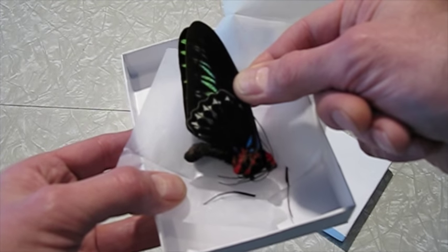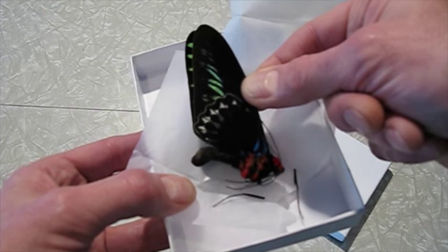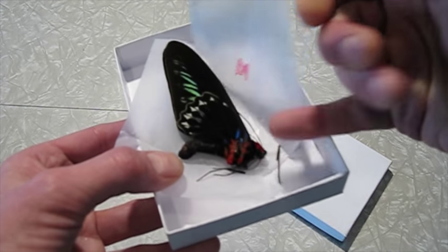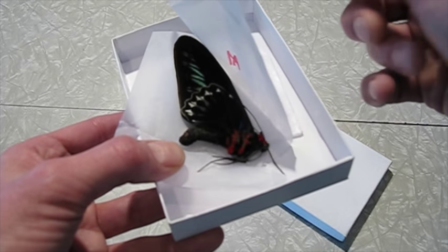It's a sustainable resource that can bring money into local communities in developing areas. They're shipped dried like this in a paper envelope, and they need to be rehydrated before we can pin them up. There's a couple of legs off here, but we'll take care of that.